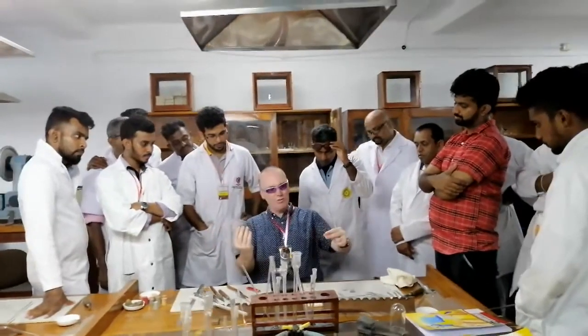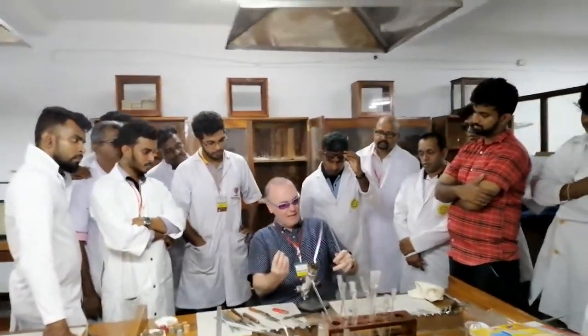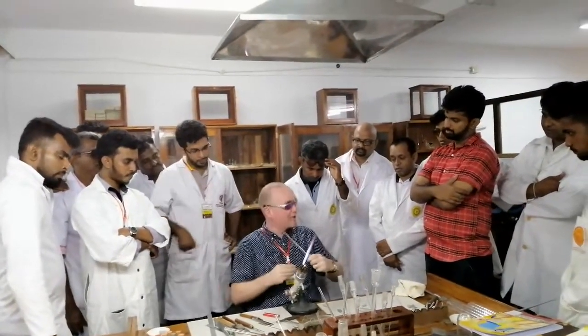Like before, when we were doing the spindles, our hands are just gliding together. But this, we are pushing a lot — but not a hard push.